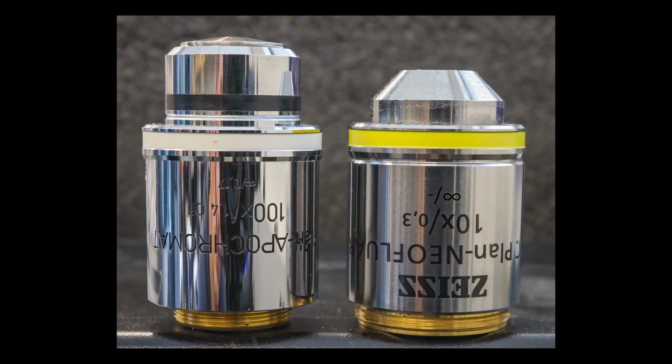Before taking a closer look at the markings on the objectives, let's compare their overall physical appearance. The blue line shows that the lower edges of the silver casings of the two lenses are at the same level in this picture. In the microscope, these edges will sit at the exact same height when we switch between objectives by rotating the nose piece. On the other hand, we see that the objective tops are at different heights.